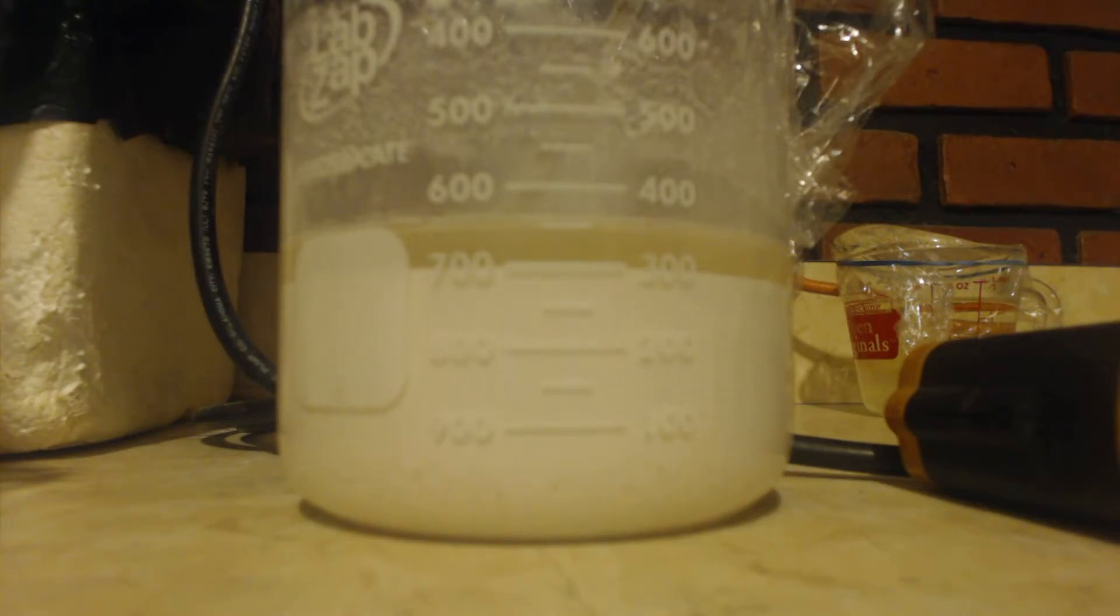And I'm sitting here editing this video that I'm making, and I'm realizing a mistake about the magnesium sulfate. Because you're making water during this reaction, you'll have some water in the mix. And plus, I didn't use totally anhydrous ethanol, so there's already water in there. My whole point is, if you use magnesium sulfate, it might dissolve inside your pot as you're putting the pot liquid through the magnesium sulfate to wash out the water, the water is going to dissolve some of the magnesium sulfate.